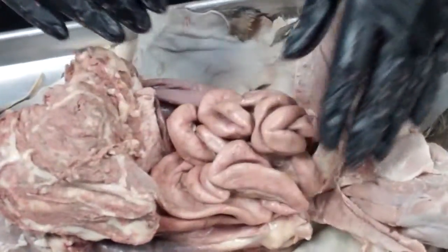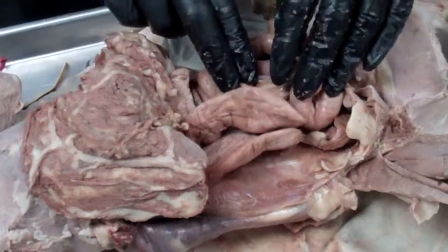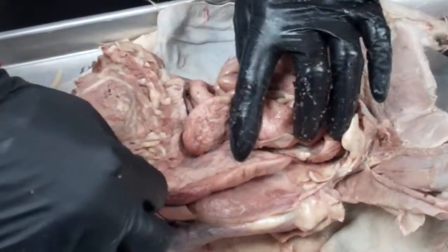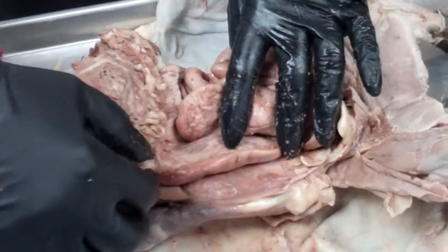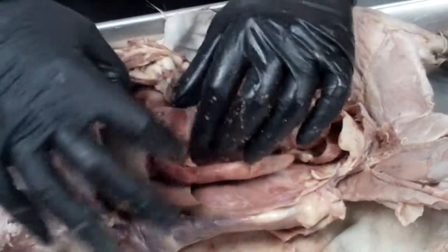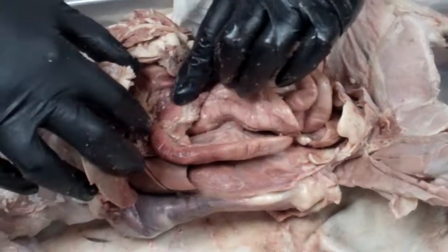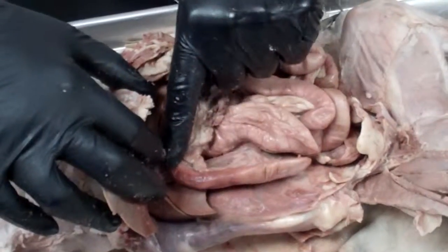The first part of the small intestines, to find that, we have to pull the intestines all the way over to the side here. And we look down to the very bottom, right where we found the pancreas. This structure right here that goes along the pancreas is called the duodenum. And that structure actually hooks up to the stomach. So if I look up here, right here is where it hooks to the stomach. There's a valve right there called the pyloric valve. And so the stomach empties its food and it goes into the duodenum here.